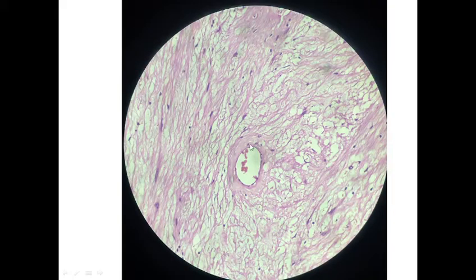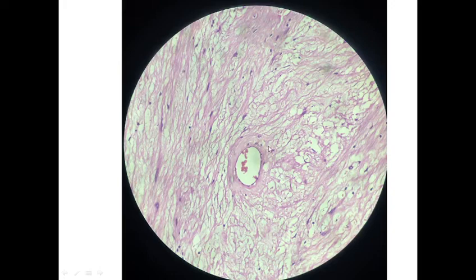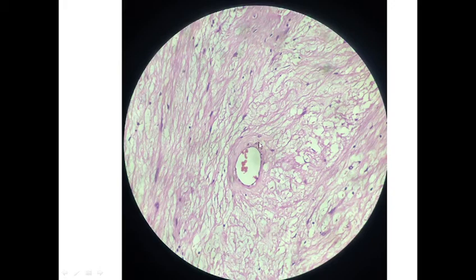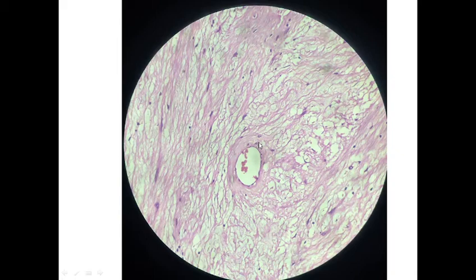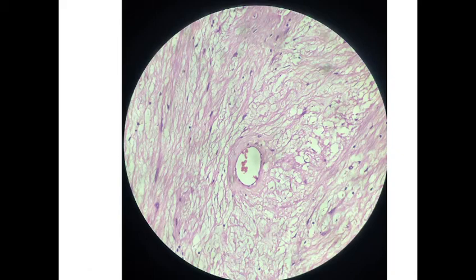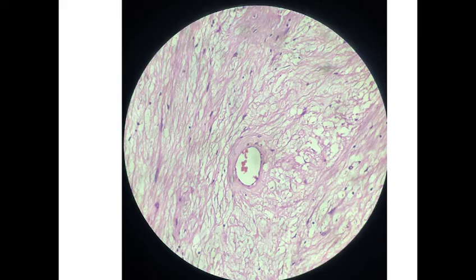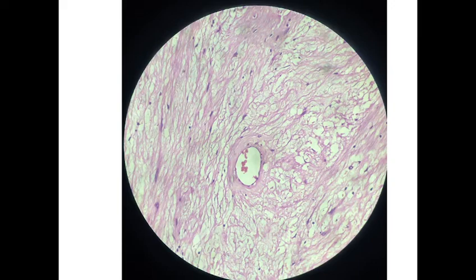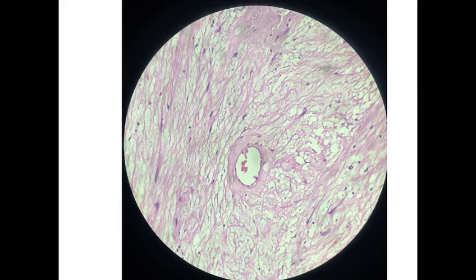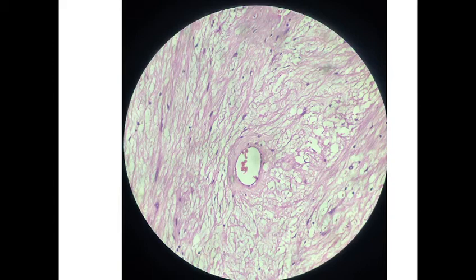Here again, in the hypocellular area, we can see the hyalinized vessels. These are some features of schwannoma. Bilateral vestibular schwannoma can be seen as a part of neurofibromatosis type 2, which is due to mutation of the NF2 gene on chromosome 22.